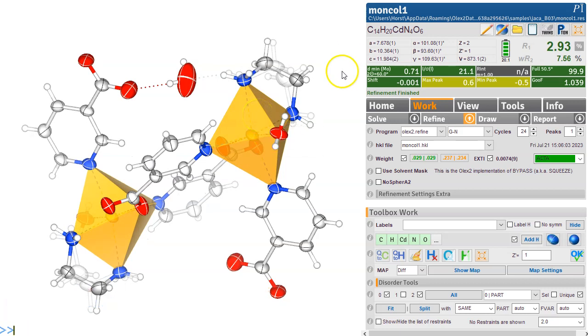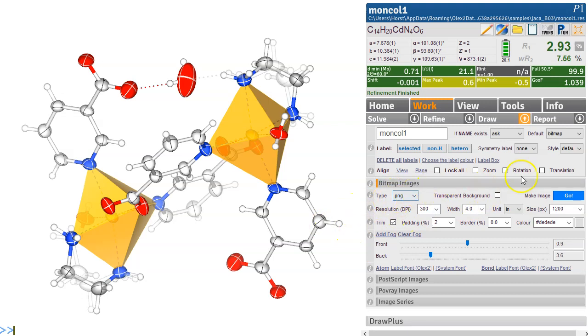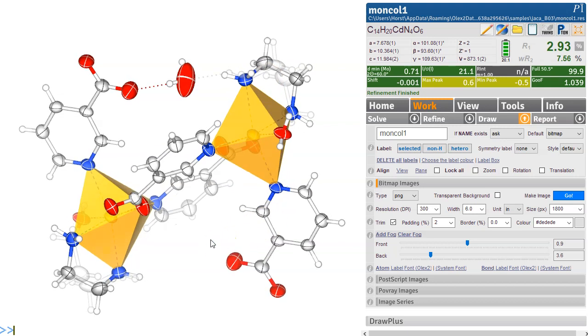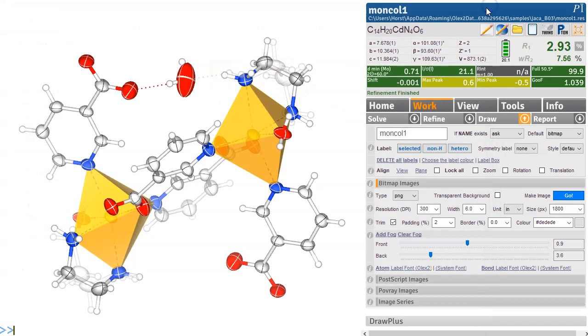So clear does that. And of course you can head over to draw, and then to bitmap images, and you can select the size. So this will be a 1200 pixel width image, but you can make this any size you like. You can type in the size you like and then just go. Or you can just press Ctrl P, and that will also make that picture. And I'm going to demonstrate this in a minute. If I just go Ctrl P, it now says it already exists. Do I really want to overwrite this? So that tells you it's done the right thing.